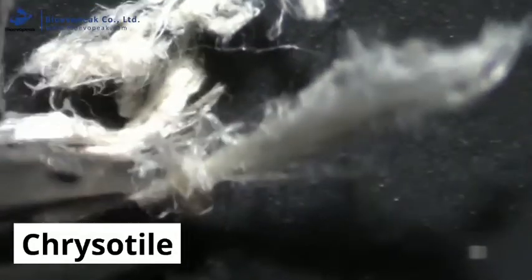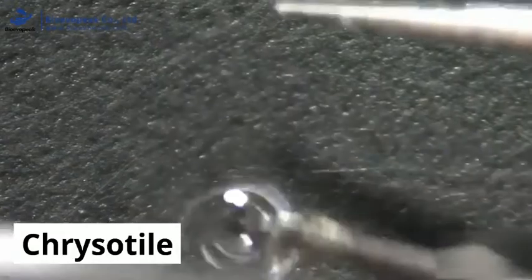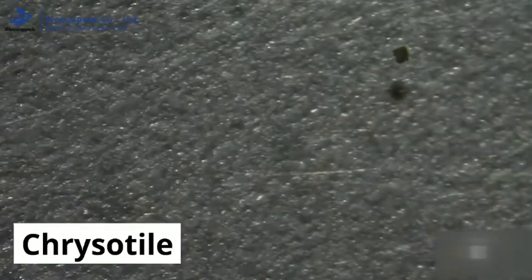Suspect fibres are then taken and mounted onto a microscope slide in a liquid which shares similar optical properties to that of chrysotile. In this case, a liquid with a refractive index of 1.550. The slide is placed under the polarized light microscope and the optical properties assessed. As with amosite, chrysotile shows little colour change under plain polarized light, and also shows little to no relief. This means that the fibres seem almost invisible at this stage.